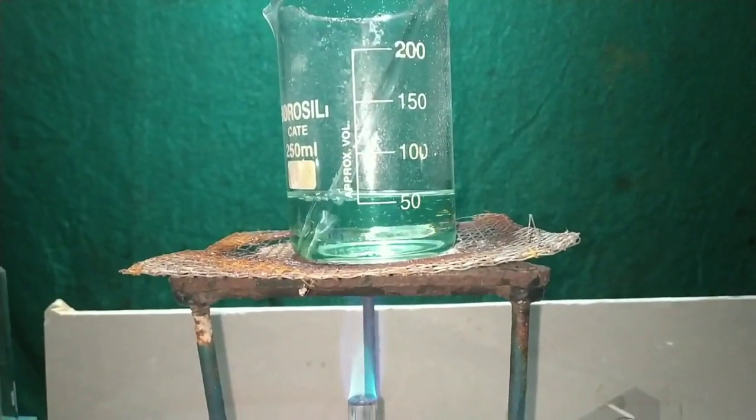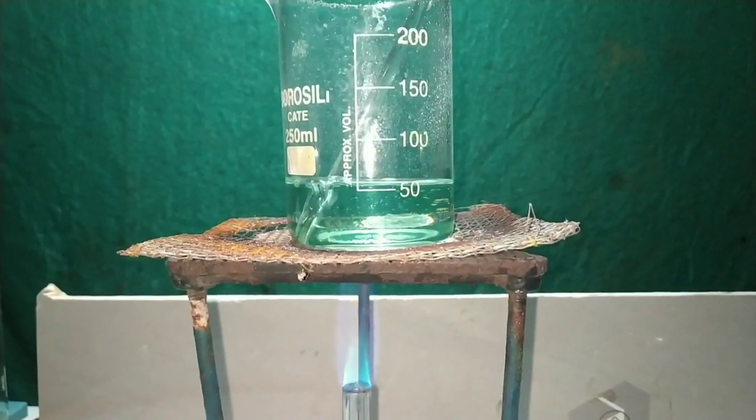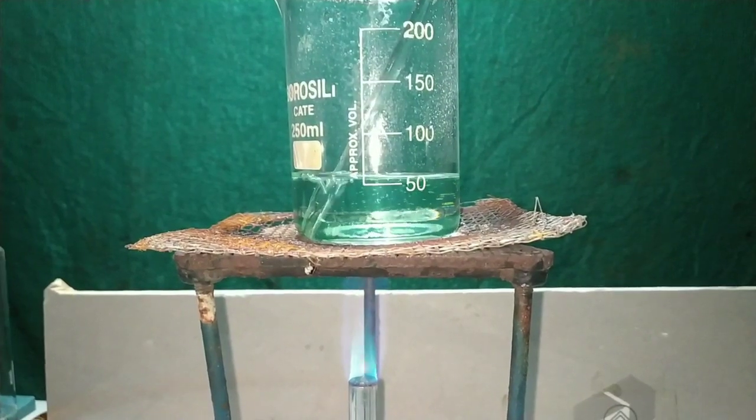After about 45 minutes, the solution has come down to 50 ml. I will still continue boiling the solution until it becomes 25 ml.